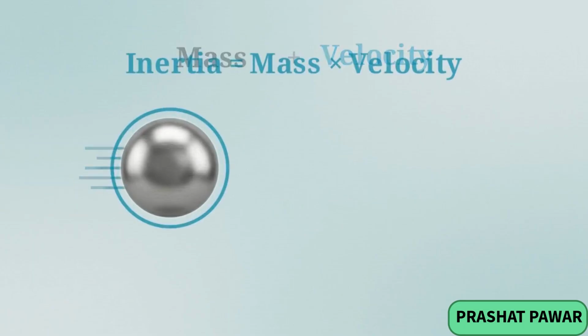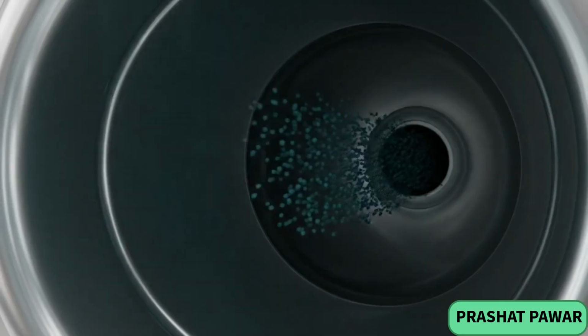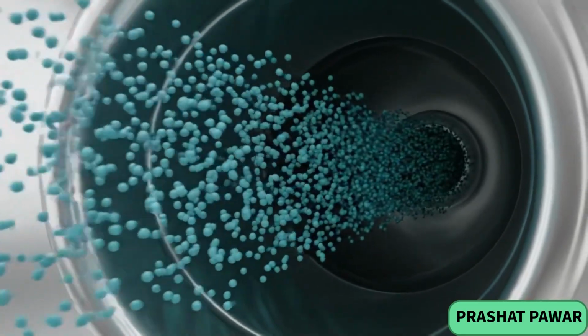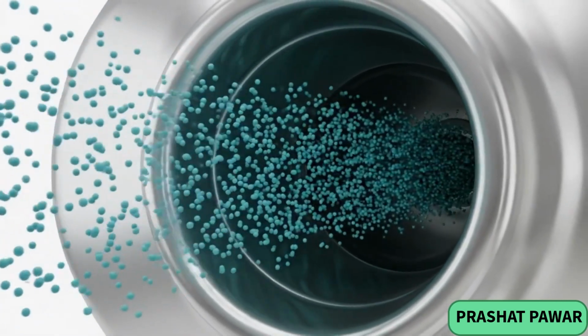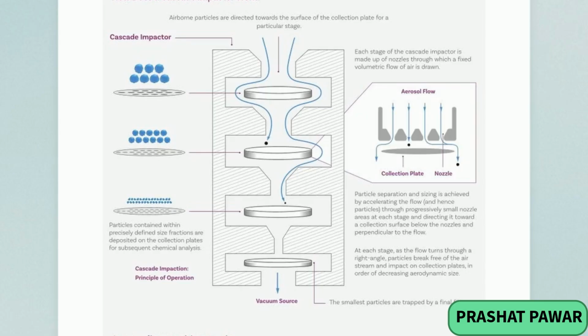At its core, an impactor separates particles based strictly on their inertia. In fluid dynamics, a particle's inertia is a function of both its mass and its velocity. The sorting process begins by drawing sample-laden air through the entire instrument at a fixed, constant volumetric flow rate. This diagram illustrates the internal mechanism.